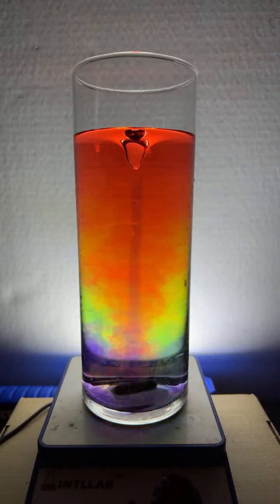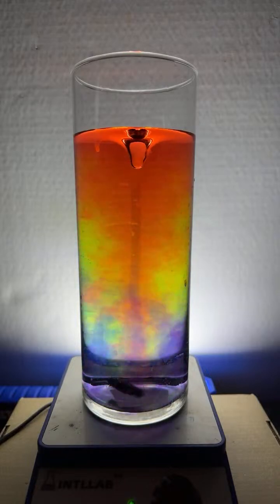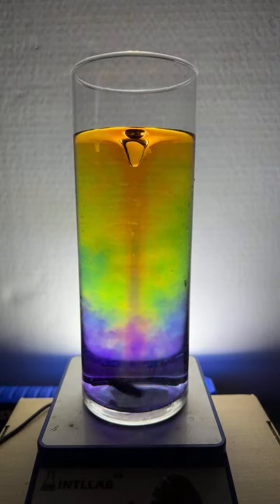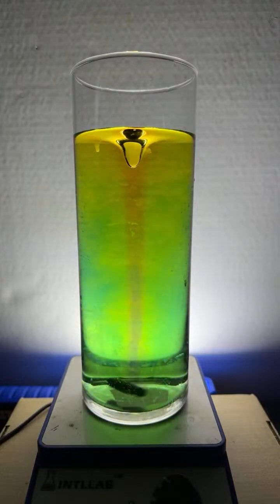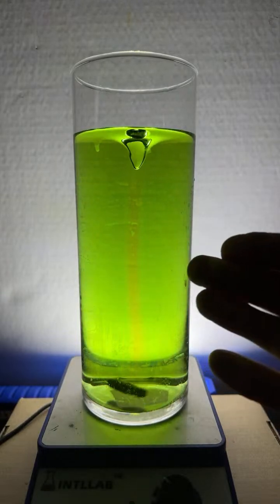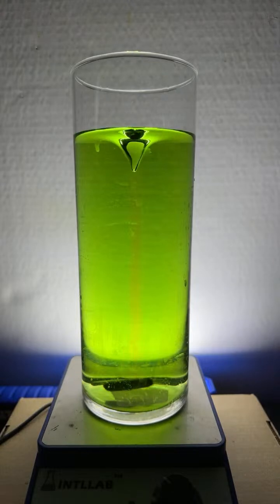And it looks like we've got the rainbow going on there. That's kind of cool when that happens. The entire flask shows all the colors of the rainbow. And the reason why that happens is the chemical reaction between the acid and base takes time. And it doesn't happen immediately. And then you can see there's different regions in the flask that have different acidities. And so you're going to see different colors.